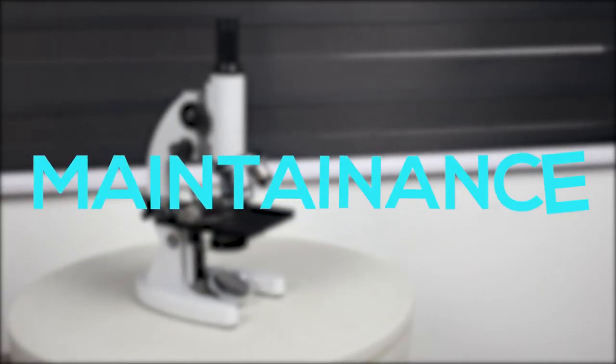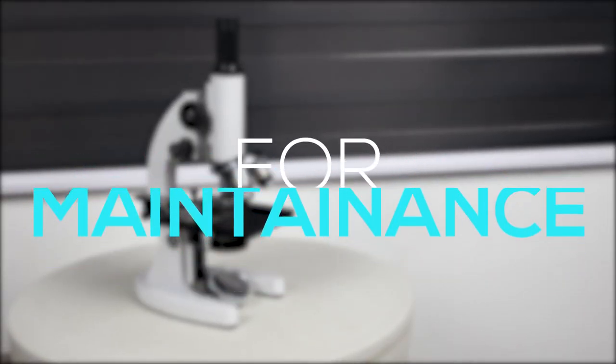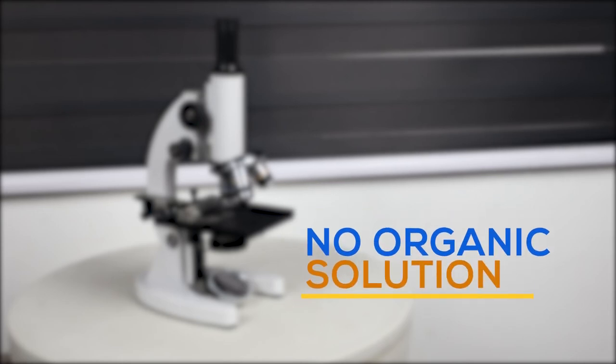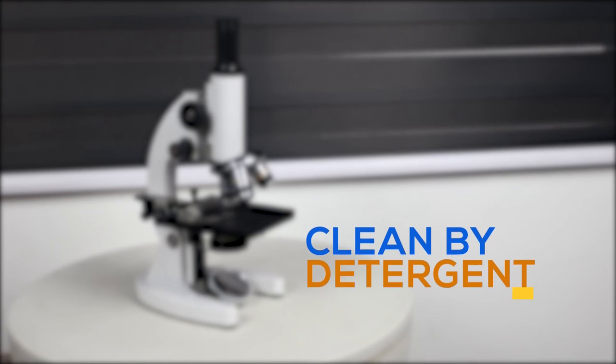For maintenance, all glass surfaces must always be kept clean. Do not use organic solution to wipe the surface of the other components. These parts, especially the plastic parts, should be cleaned with a neutral detergent.